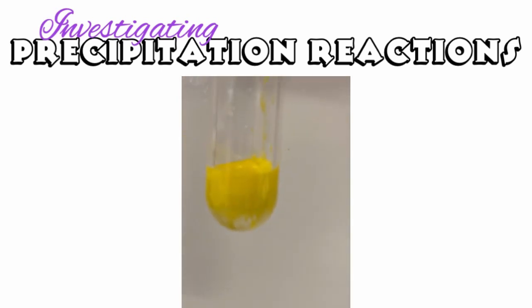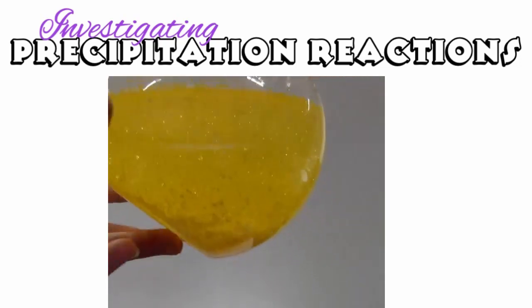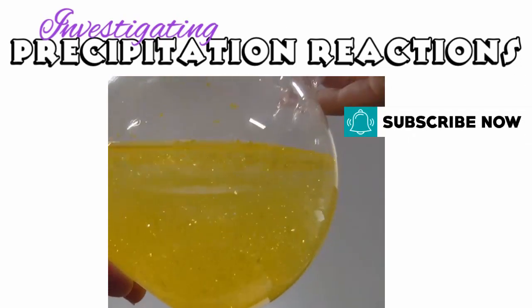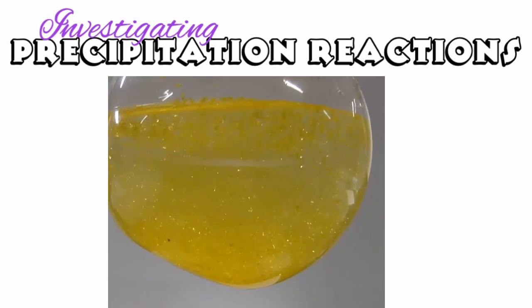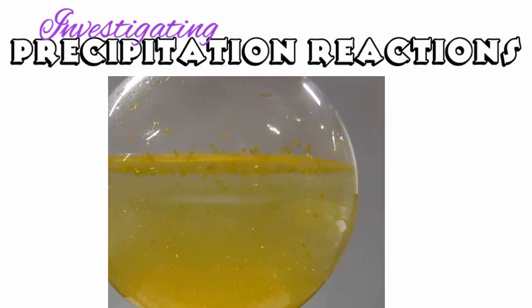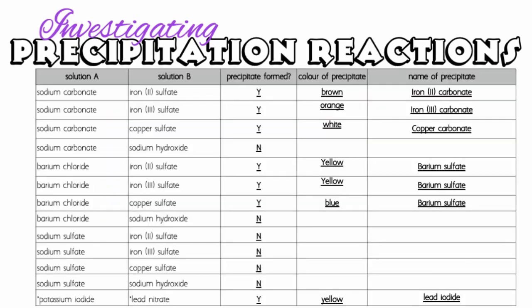Now, I've actually got the exact same reaction, but this time the precipitate forms and it makes it look like golden rain. So this is still the potassium iodide and lead nitrate, but what I actually did was I heated it so that we could redissolve the lead iodide back into solution. And as it precipitates out again, it looks like glitter. So here's the results of those reactions.